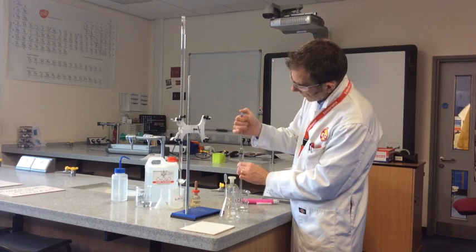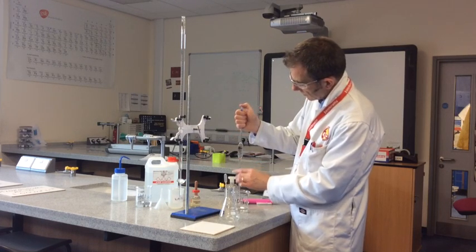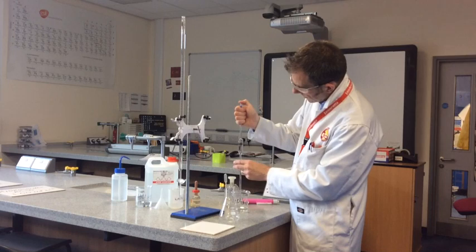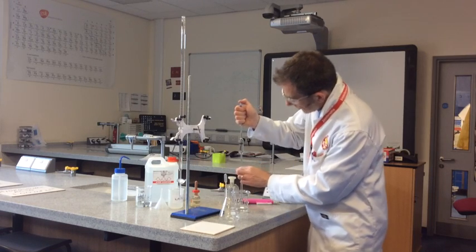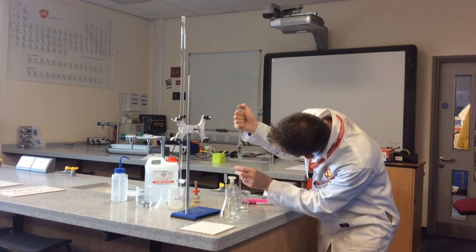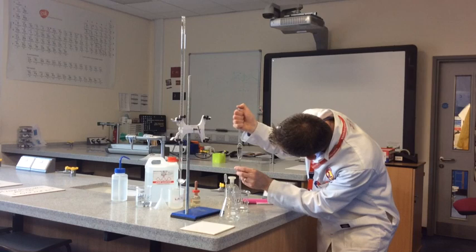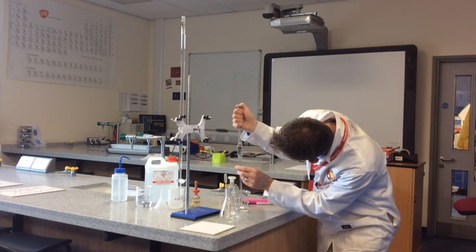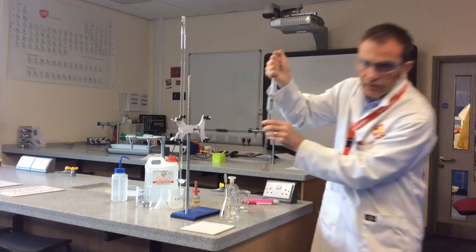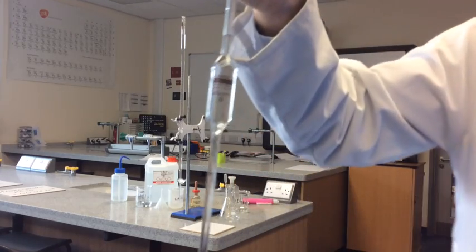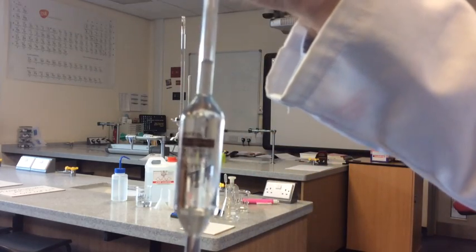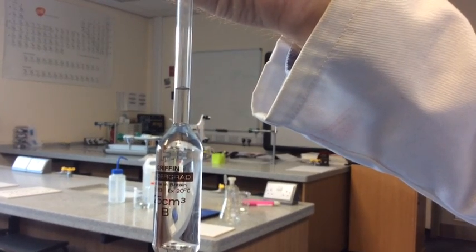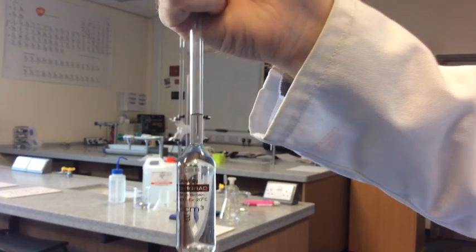This takes a bit of getting used to, but once you get the hang of it, it's absolutely fine. So we're just dripping back into there. You might want to get to eye level so that you can see exactly when the meniscus hits that line. There it is. I'll just bring that closer to the camera so you can see. Focused. There. Absolutely perfect.